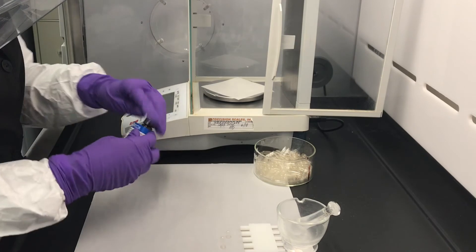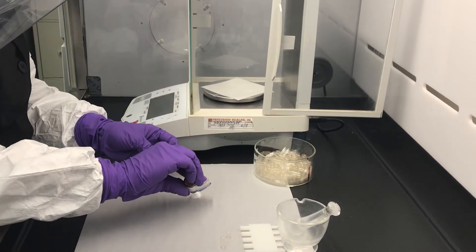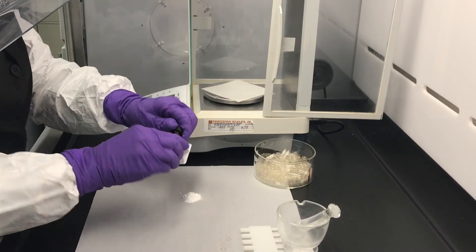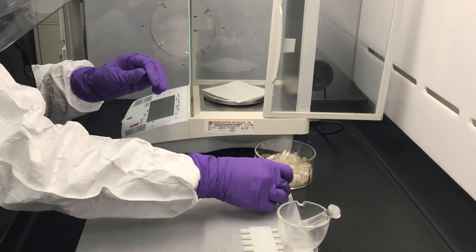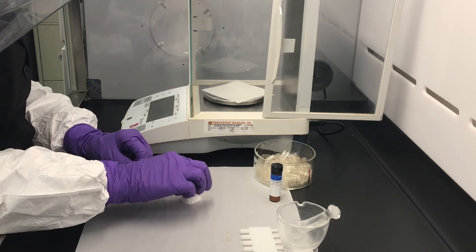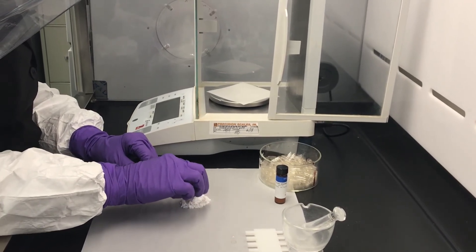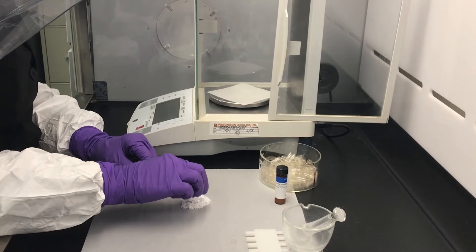Empty some of the chemical onto a clean piece of weigh paper in the hood. Using the bottom portion of the capsule, begin tapping on top of the powder so that the powder is getting pushed inside the capsule. You will keep doing this until you feel that the powder is pretty tight and not much more can be added.